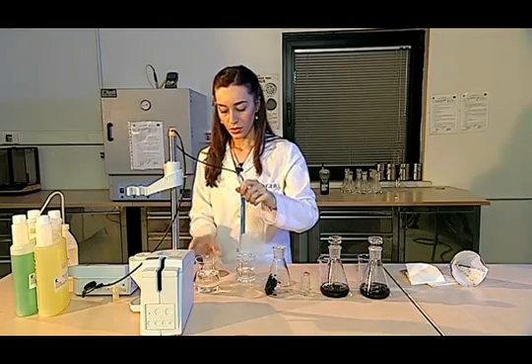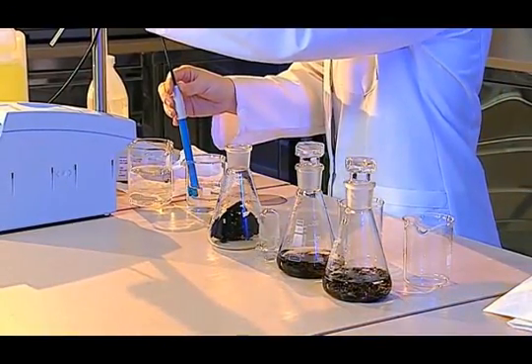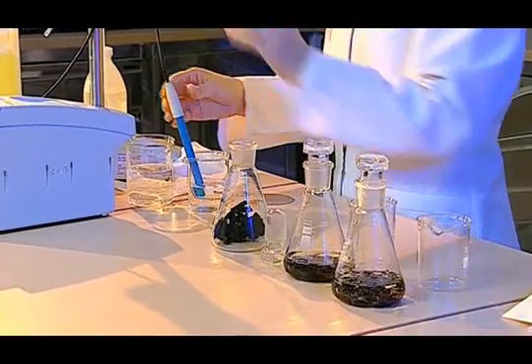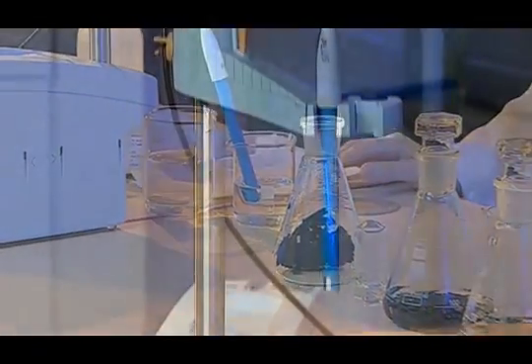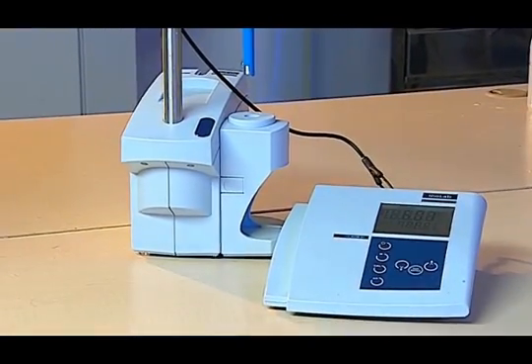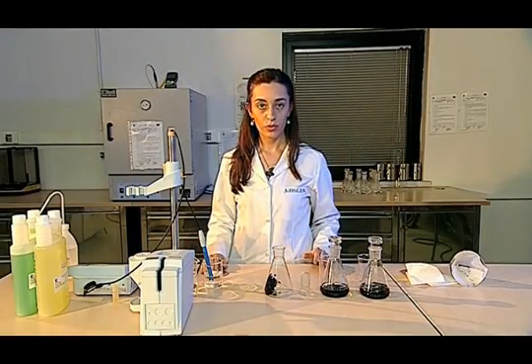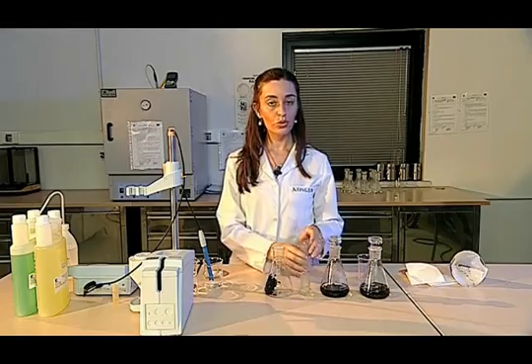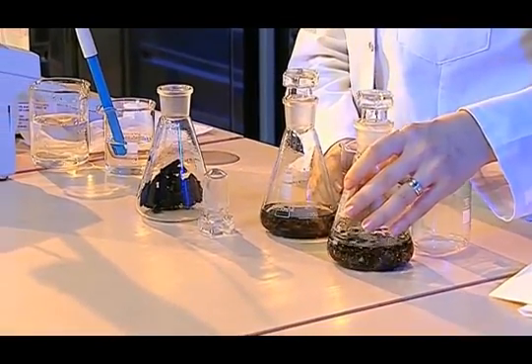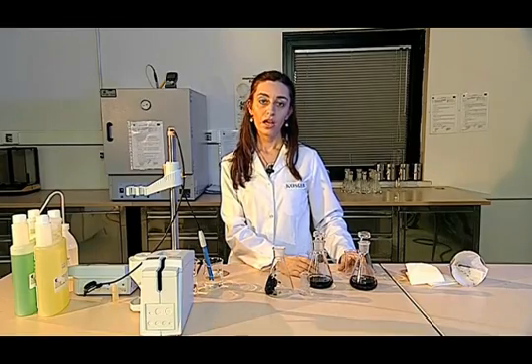At this stage, the only thing to do is to wait for the fixation of the pH. The obtained value is not taken as the test result. We use this value only to reach the stability of the pH meter. Then we filter and measure the pH values of our second and third samples in the same way. And we give the pH test result by calculating the arithmetical average of these second and third pH values.